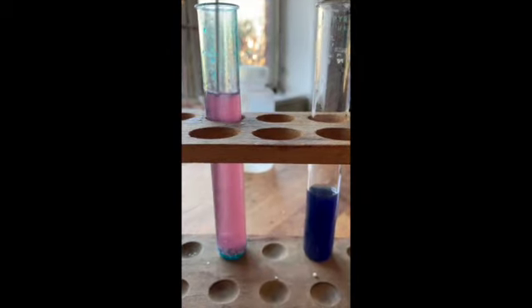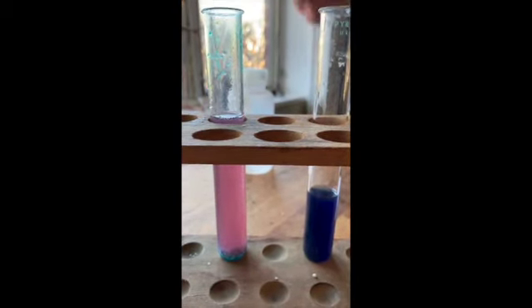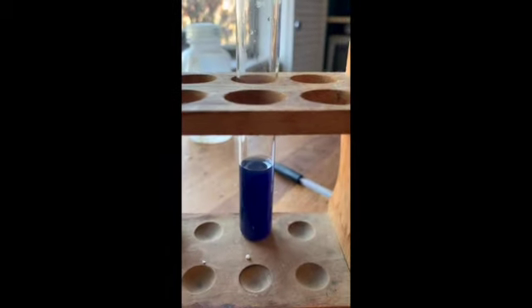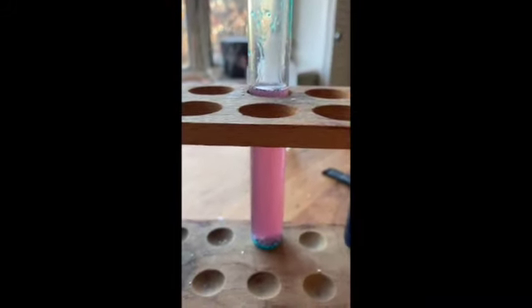You can definitely see we have now changed that system — it has shifted over and we are clearly on the pink side. That's a much easier color change to see. So we saw it go from that deep purple equilibrium color, shift over to blue when we added calcium chloride, and now we have shifted over to pink after adding water.